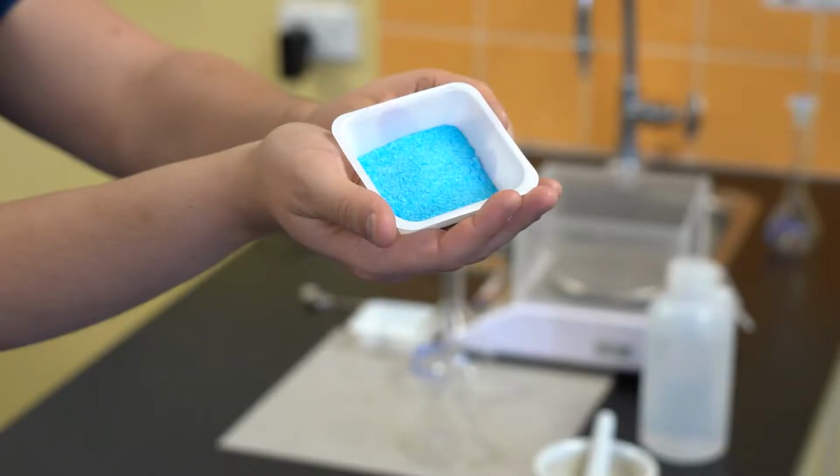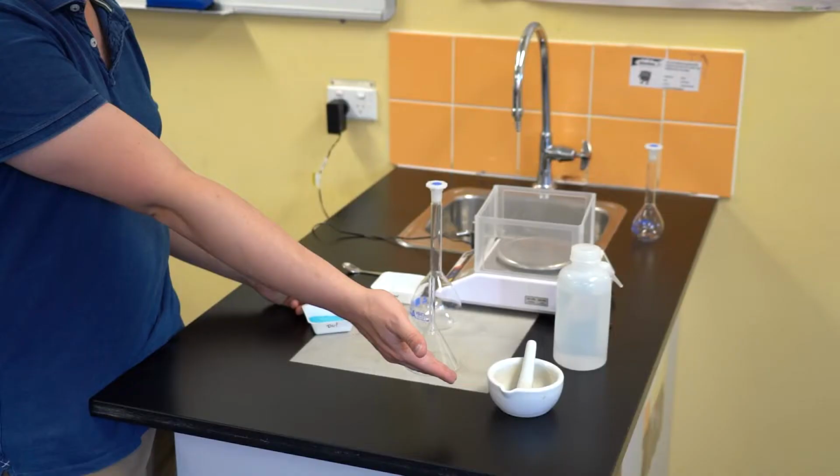The copper sulfate particles that I'll be using to prepare my solution today are already quite fine grained. They're pretty much just powder. This is going to be really advantageous when forming a solution because the high surface area of all of those small grains will mean that it won't take very long at all for those particles to dissolve in the water. If you had larger crystals, I would highly recommend using a mortar and pestle to crush up some of the grains, make them significantly smaller, and increase their surface area.